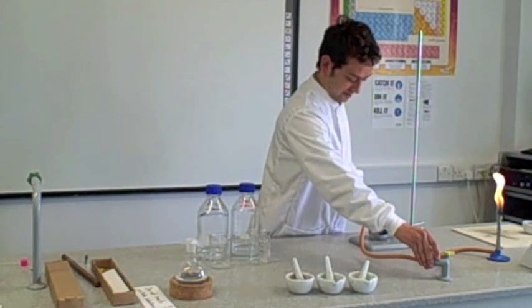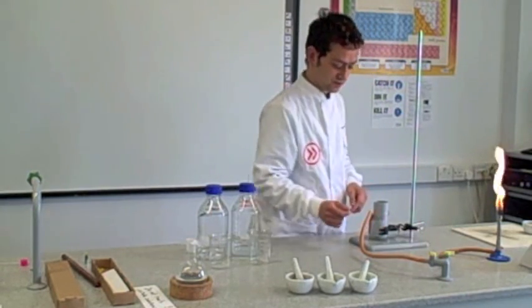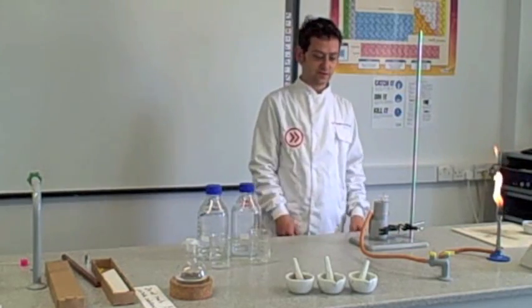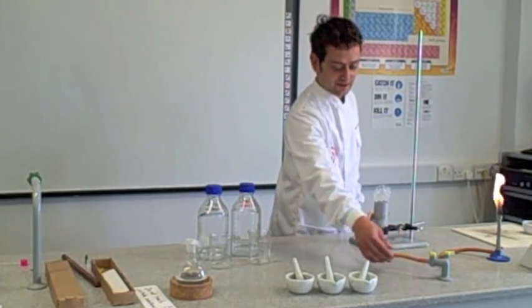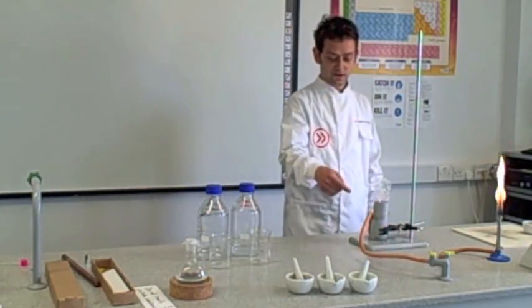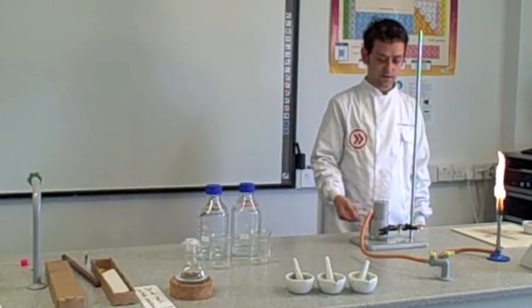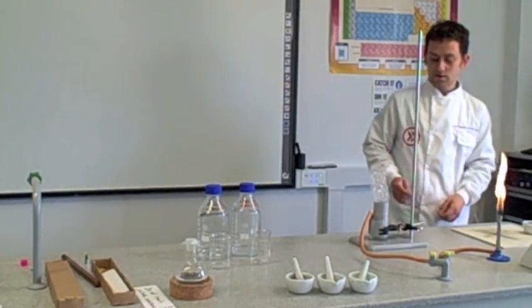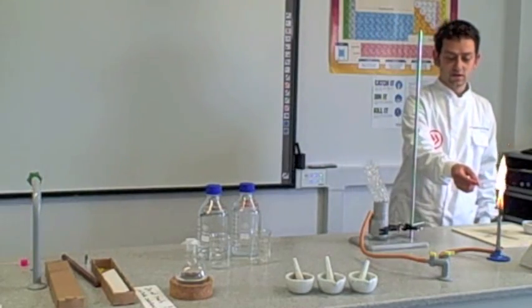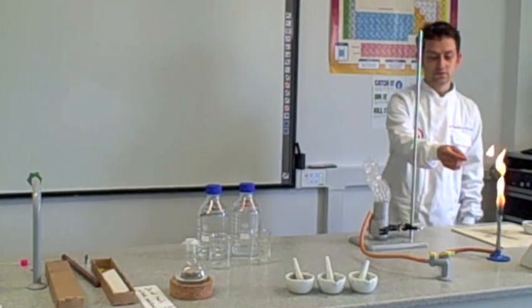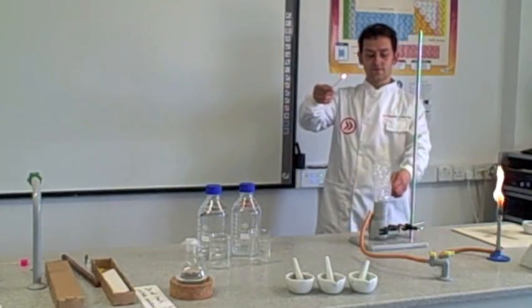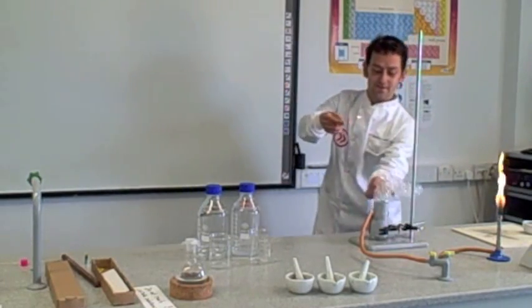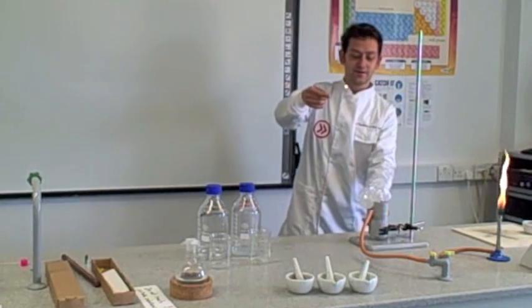What I've got in here is some washing up liquid and some water. Simple as that. This is methane gas coming in from the gas, and the pipe is going under and up and through this tube here. This is what we use to demonstrate the concept of flammable to the students. You can see this methane trapped in soap bubbles coming out.